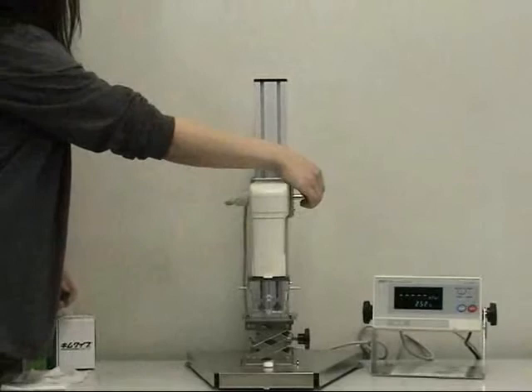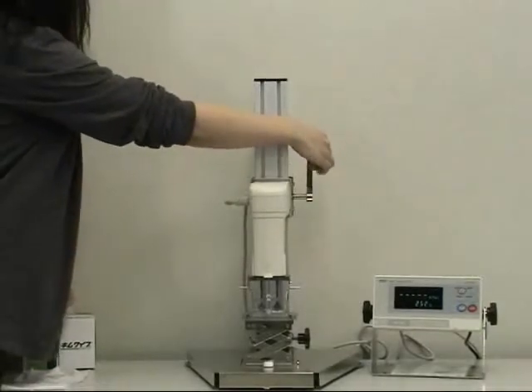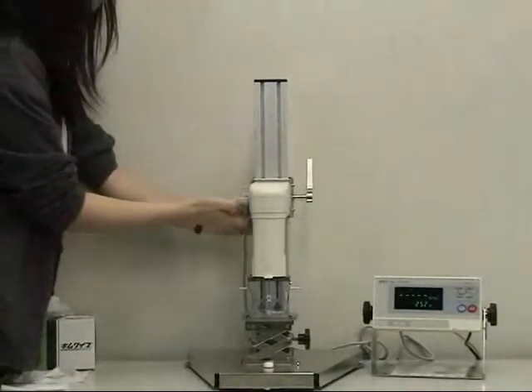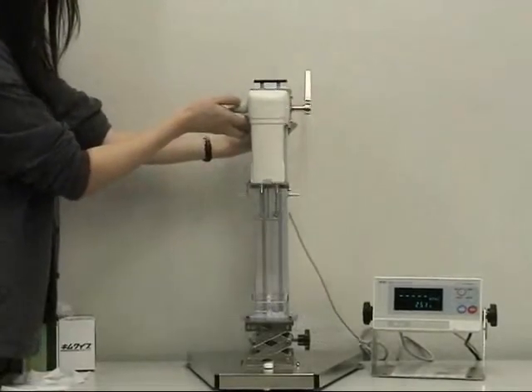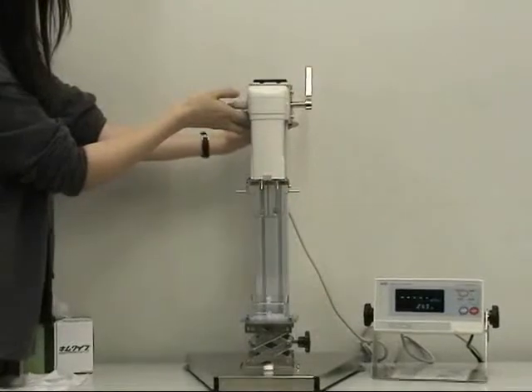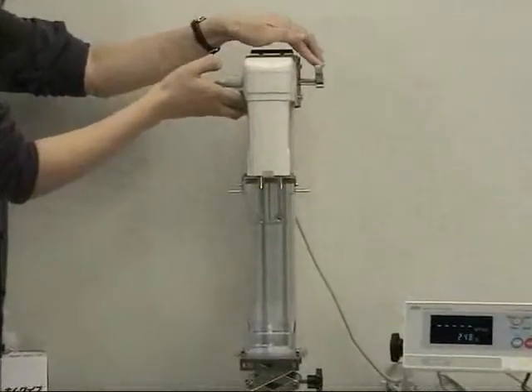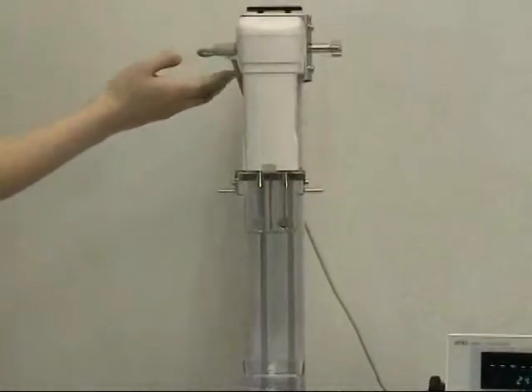After use of SV10, cleaning is necessary to avoid measurement errors caused by residue from old samples. Any residual sample materials from the protector, sensor plates and temperature sensor should be removed.